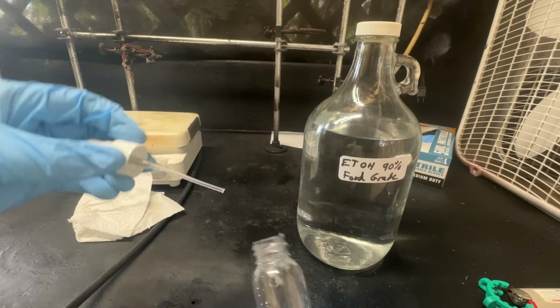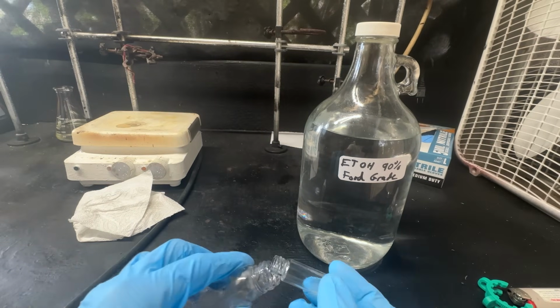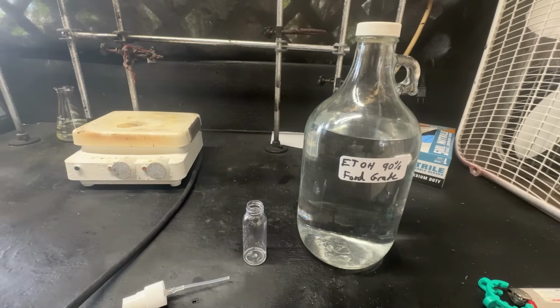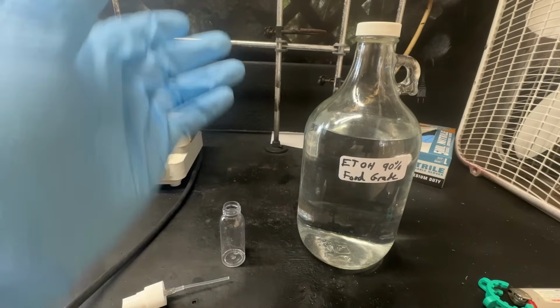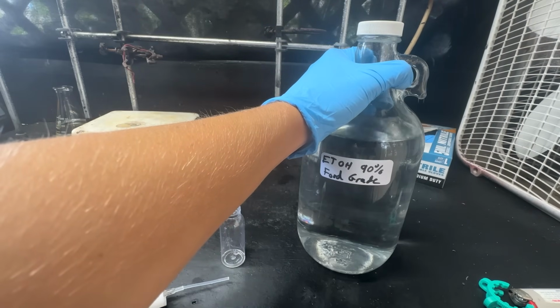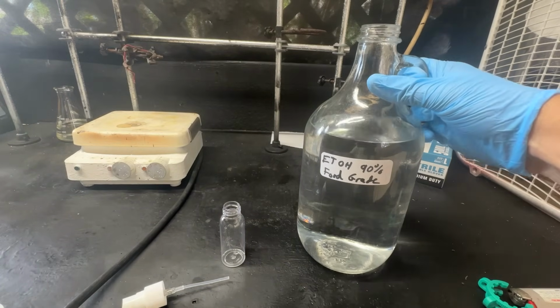So I've got this little spray bottle here, and the first thing I'm going to do is add our small sample of isovaleric acid. I'm just going to dump the whole thing into our container here. That should be plenty of it to induce quite a nasty smell. Okay, and now we need a solvent for isovaleric acid to make our perfume. Like most perfumes and colognes, they all use alcohol. In this case, I'm using 90% food grade moonshine. This stuff is pretty much just poison. It's 90% alcohol. If you try to drink this, you will die.